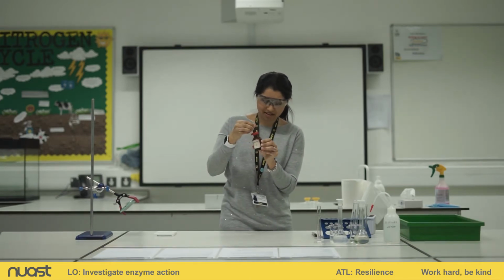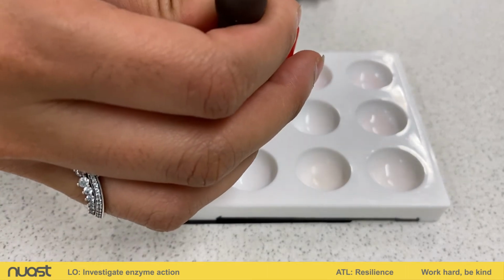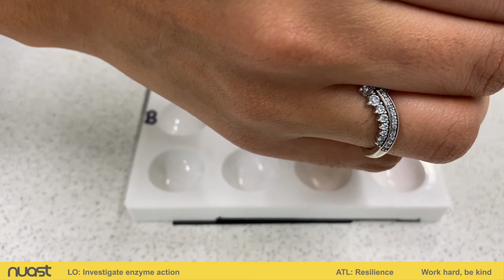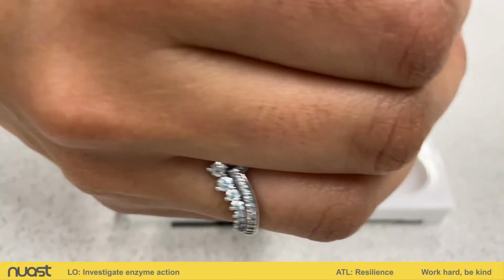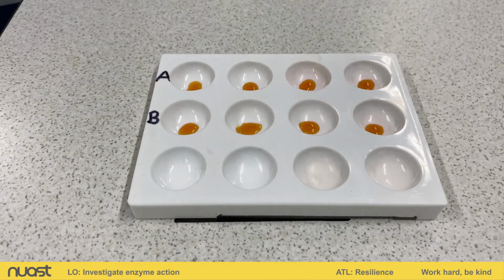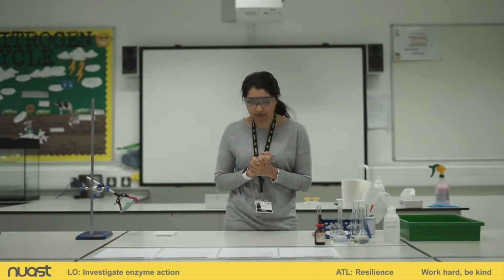And remember, iodine is an irritant, so I need to be very careful when I do this. Okay, so I've been very careful and putting just 2 drops into each of those wells labelled A and B.